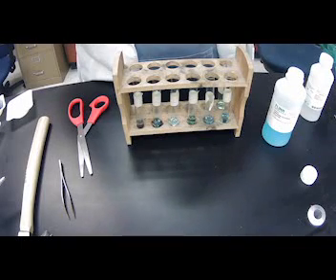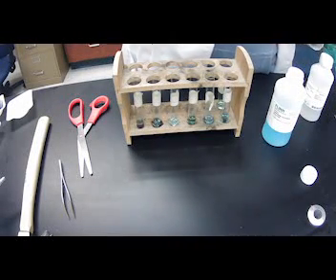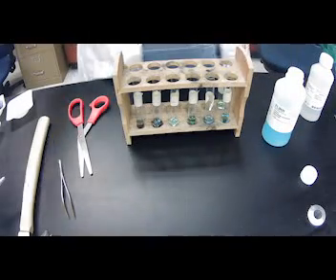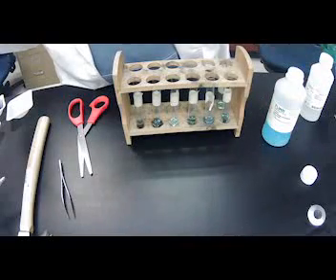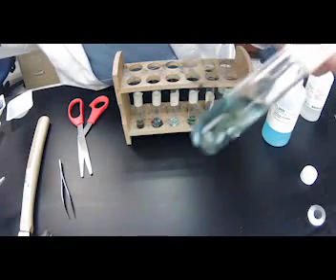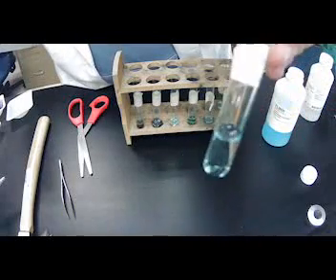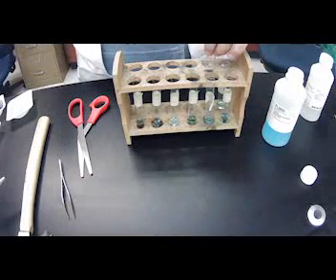And our last one is zinc. Almost immediately when I added the copper chloride, the zinc turned like a dark black. Okay, there is nothing else, but zinc definitely had a reaction and it turned like a dark black. I don't know if you guys can see that in there, but it's black. So that definitely had a reaction.